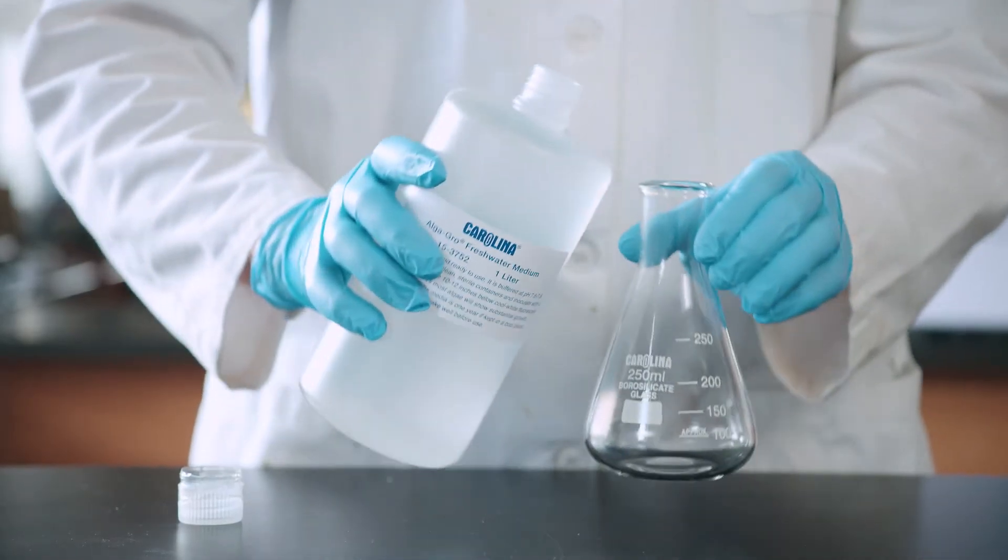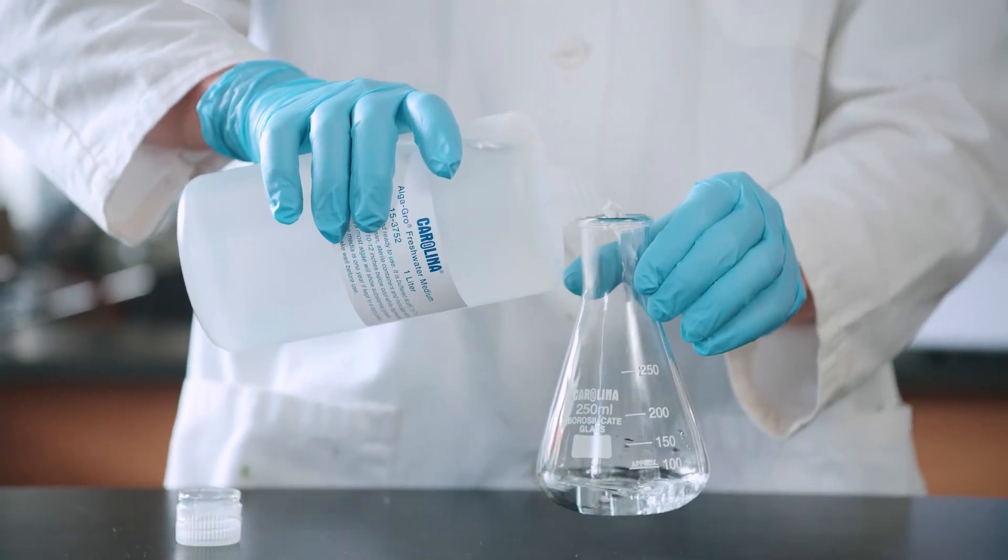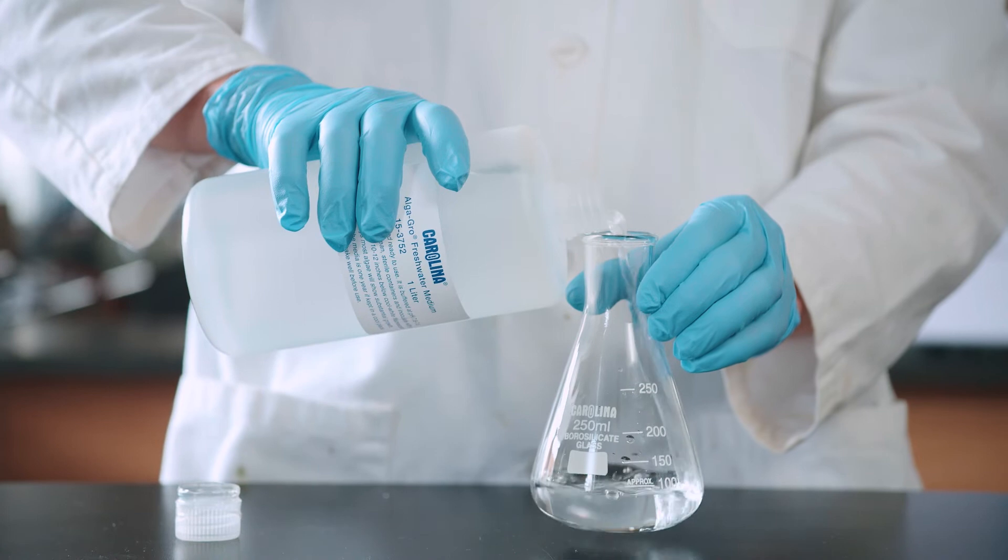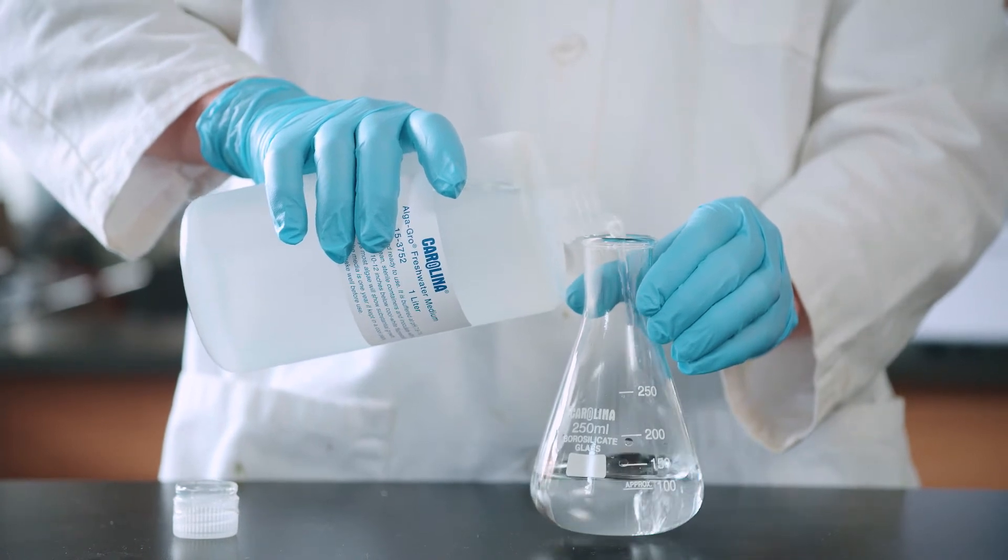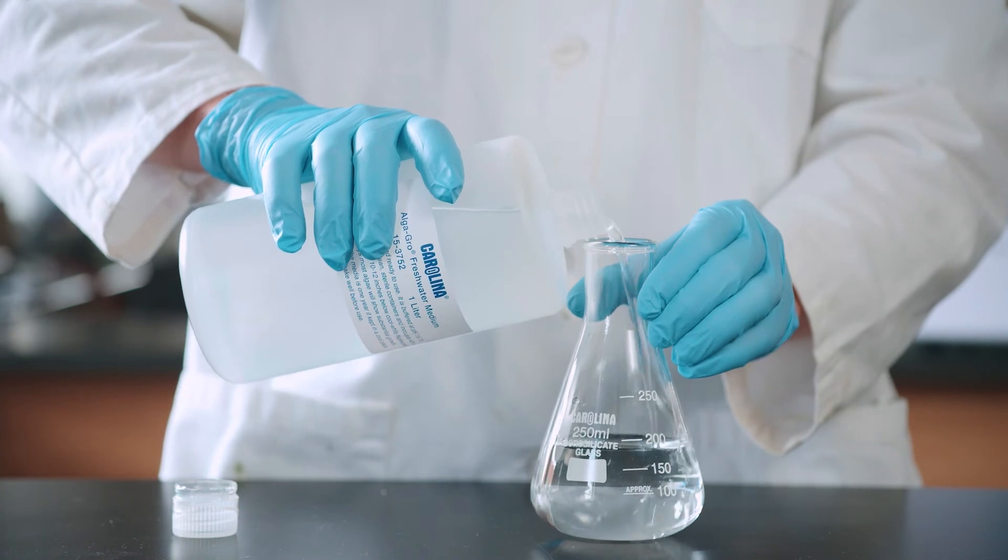Once all materials are sterilized and cool, add 200 milliliters of fresh media to your chosen container. We recommend Erlenmeyer flasks, however any glass container that has been thoroughly rinsed and sterilized will do.